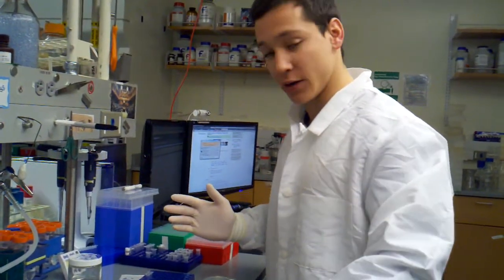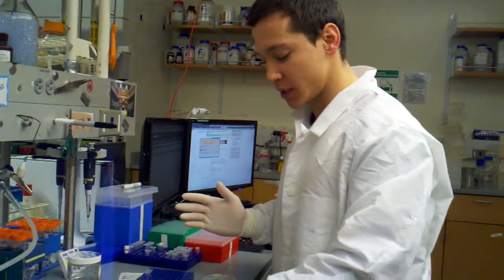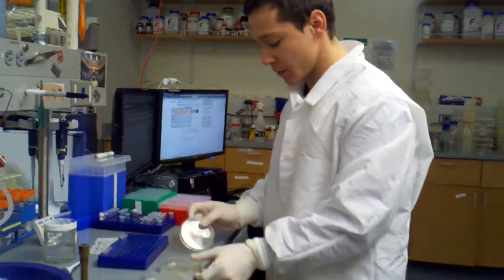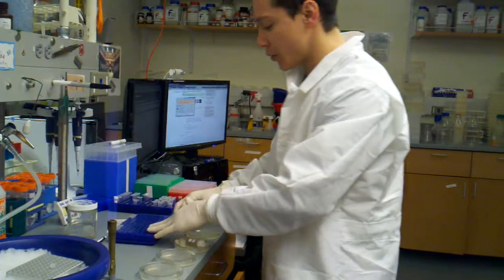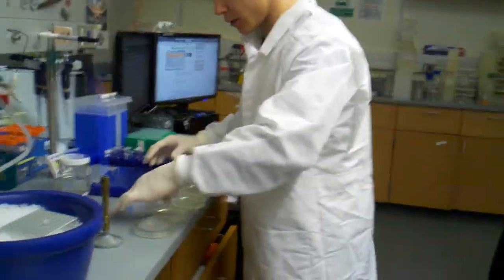So I've already posted a video on how to plate, so I'm not going to go over it in too much detail. And I'm just going to try to zoom through this as a quick reminder of what you do.